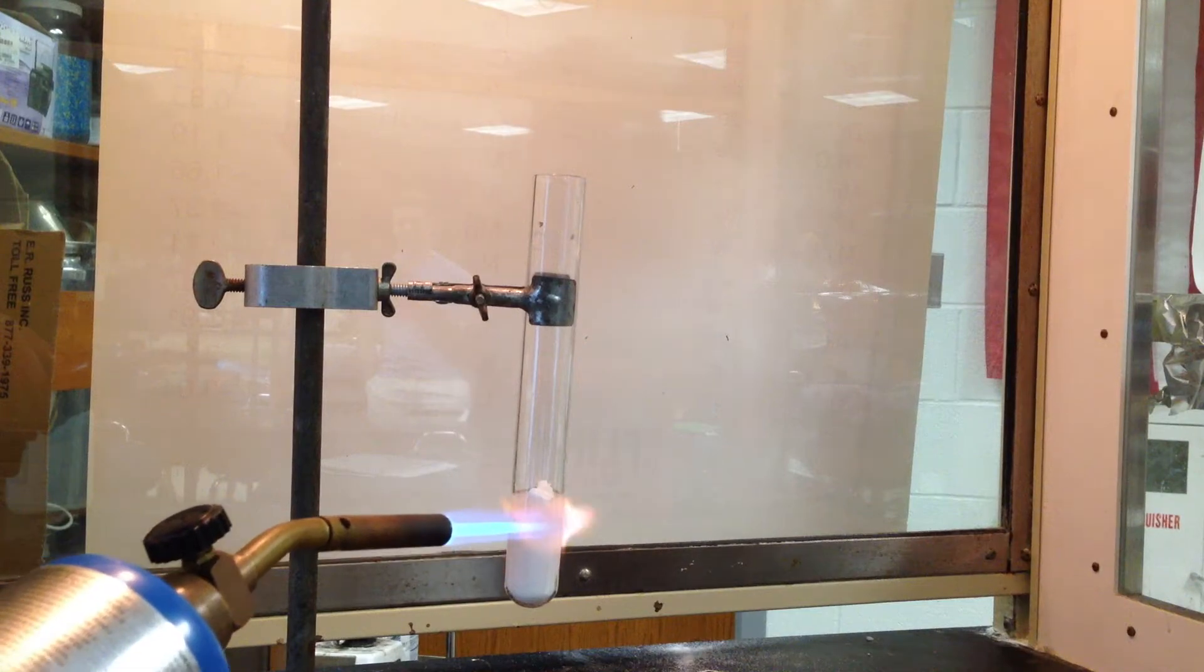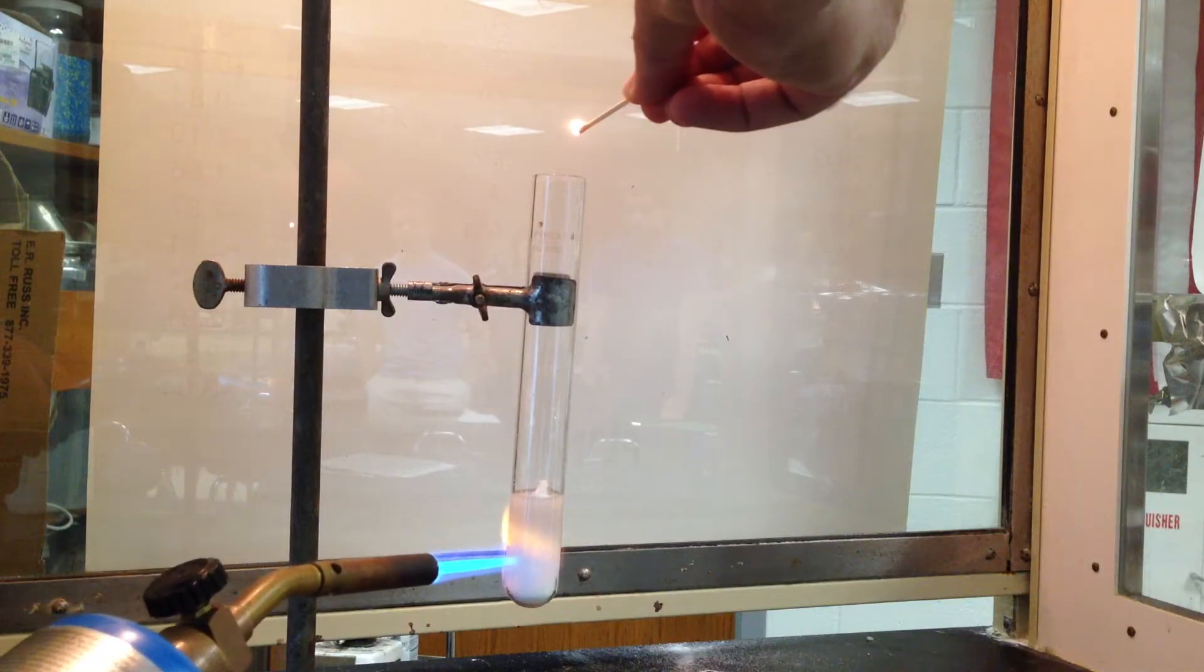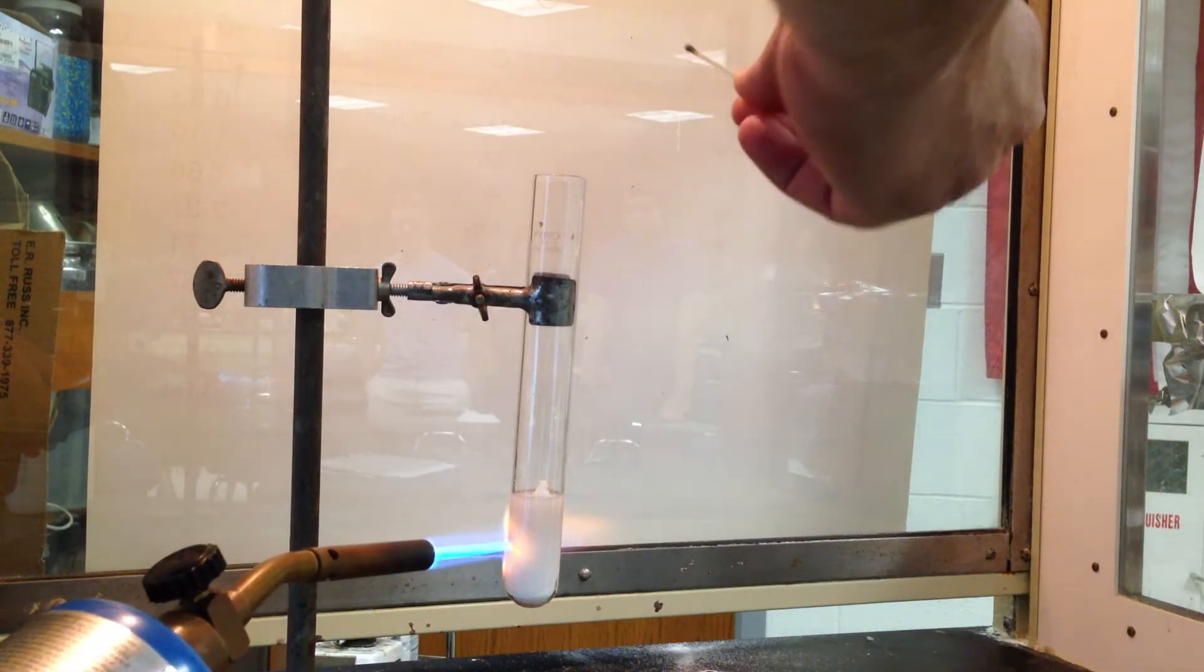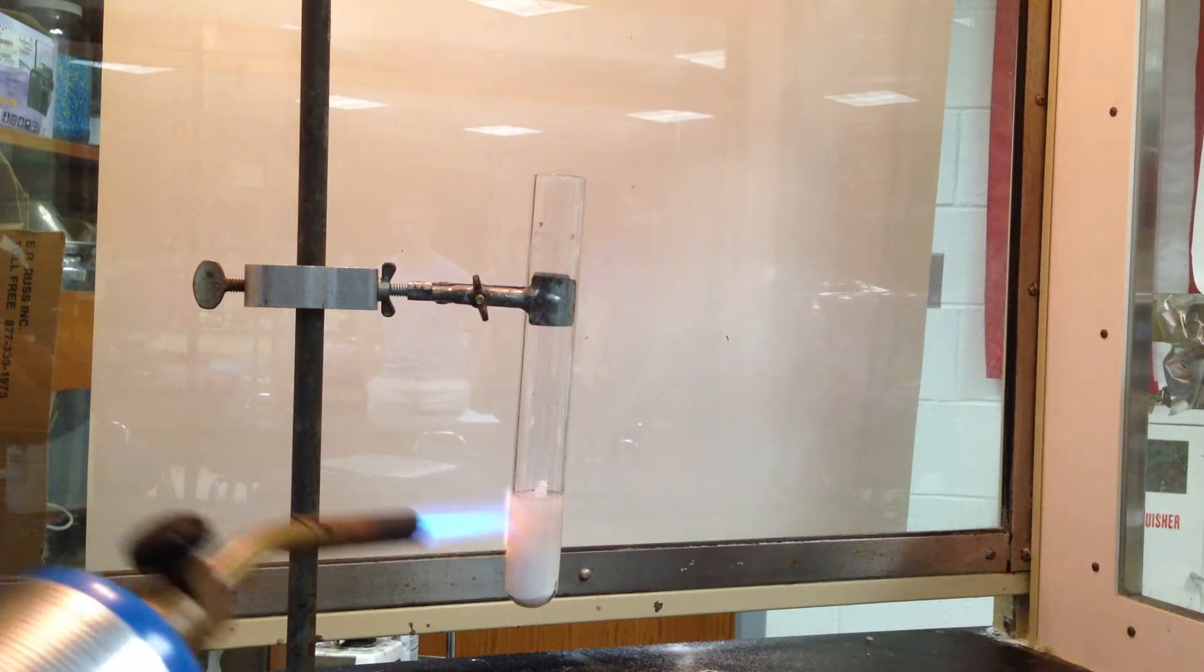So as we're making this, I'm lighting a match. I'm going to see if I can increase the rate of combustion. I'll probably need a splint, but it's okay. I'm almost ready.